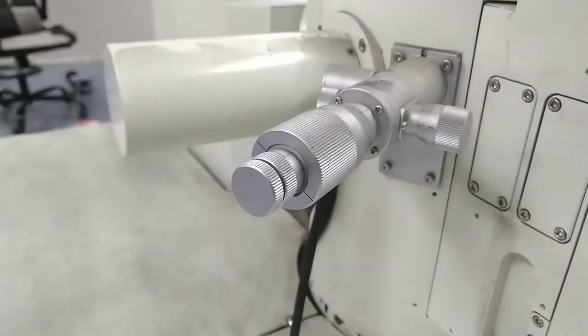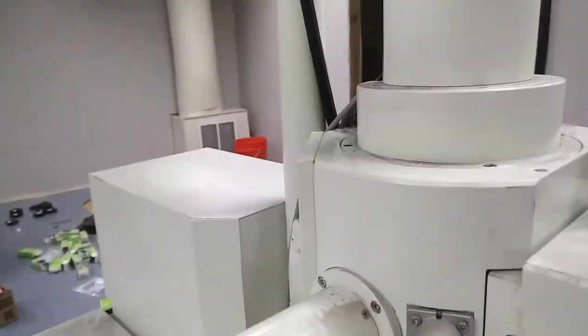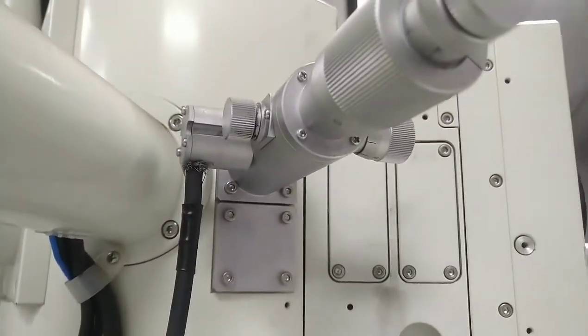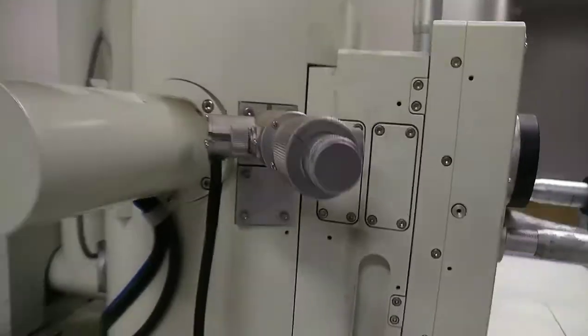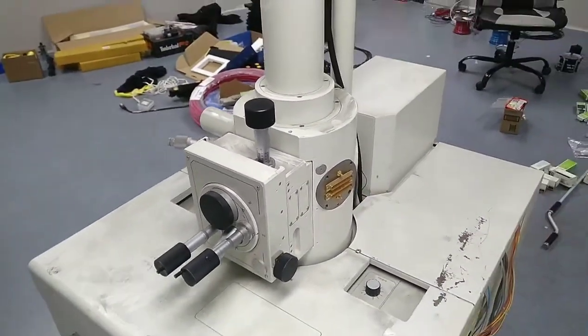It has what might be the sensor here. I don't know enough about these — I guess this part is going to be the sensor, so this might be another slide. Not totally sure; I haven't read the manual on these. But it's very similar to the one Ben at Applied Science has, so that should work in my favor.